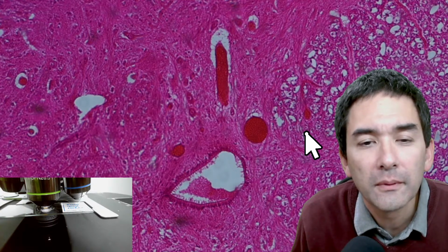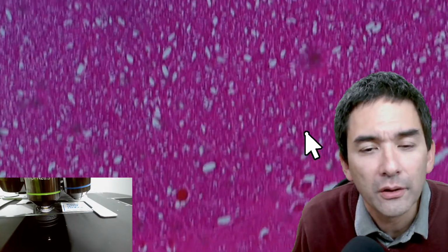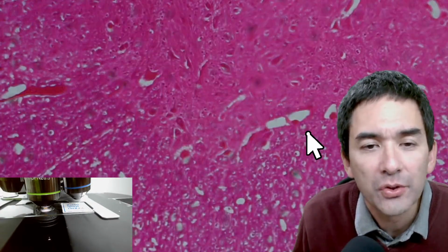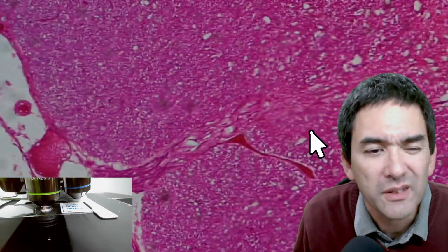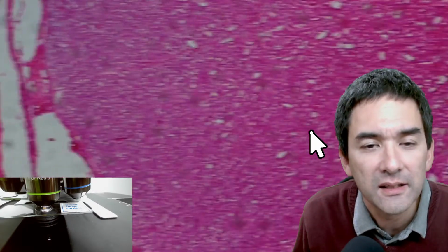And I think just by looking at a structure like this, where so many cells are packed so closely together, where it's so difficult to see the individual cells, it becomes a little bit more understandable why people were not sure. Is this even made of cells? Where does one cell start and the next cell stop?